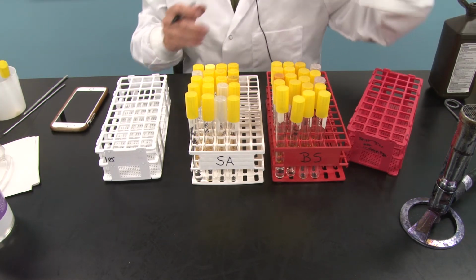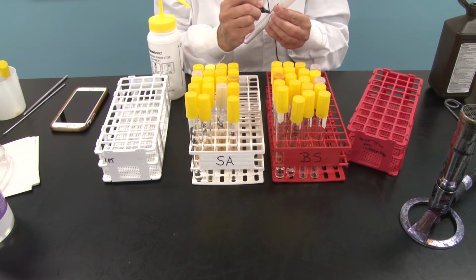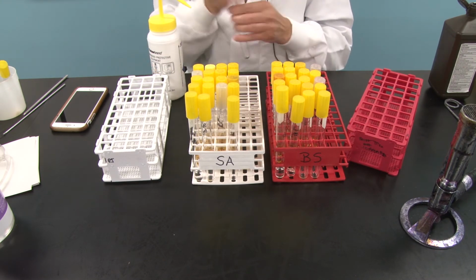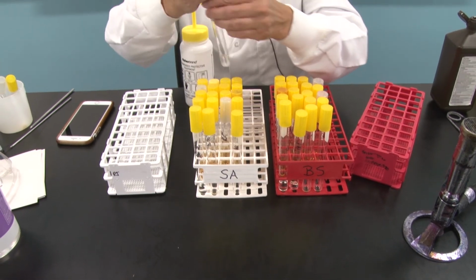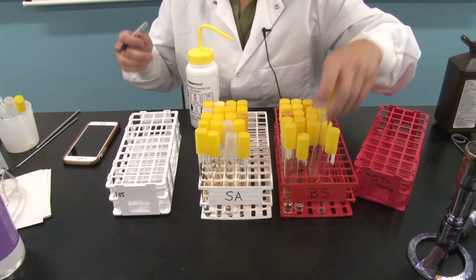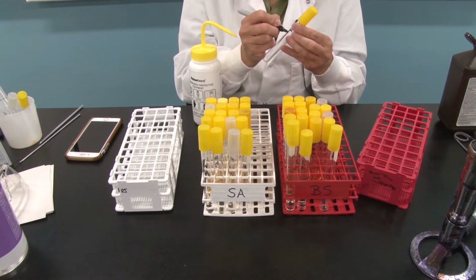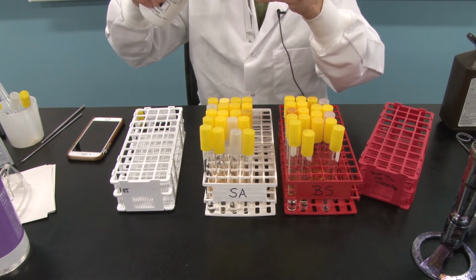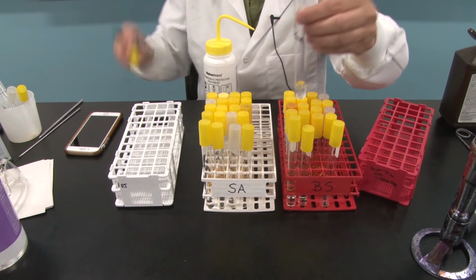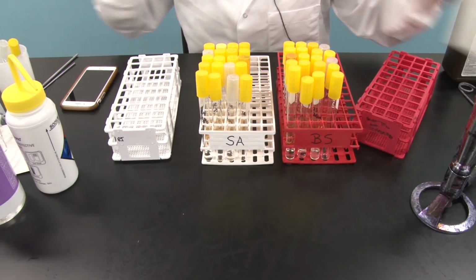We've got bleach. In our third empty test tubes under SA, I'm going to write bleach. I'm going to squirt thumbnails' worth of bleach in there. Again, not completely controlled, is it? I ought to be ashamed. Shockingly, I'm not. That's close enough for government work. And there we go. Now, the Bactine.